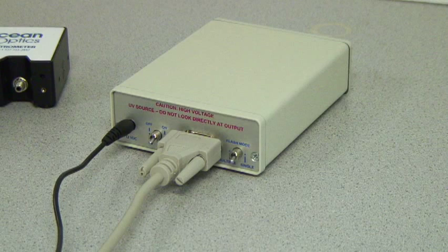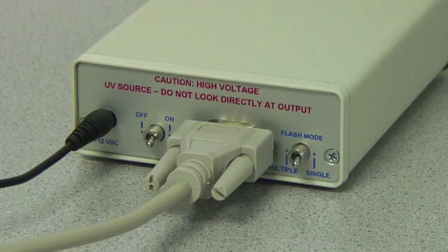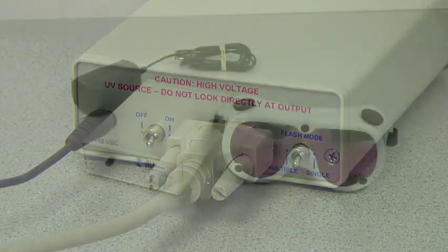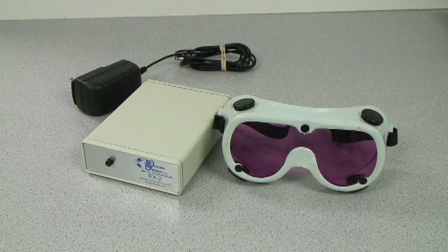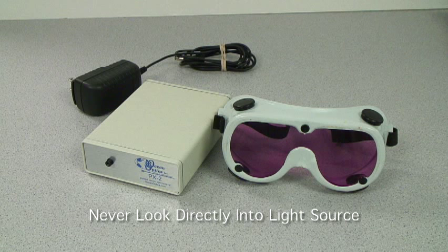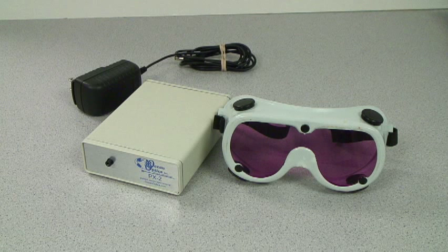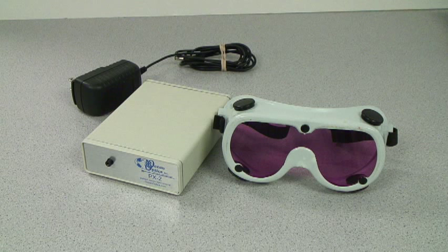Remember, the PX2 produces ultraviolet radiation that can cause permanent eye damage. Always wear safety eyewear during operation and never look directly into the light source. To avoid exposure to dangerous voltages, do not run the PX2 unless the housing is on and closed. And remember, always allow the lamp to cool before handling.